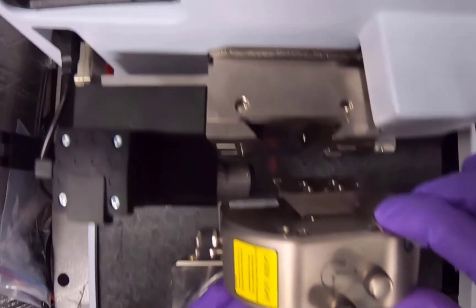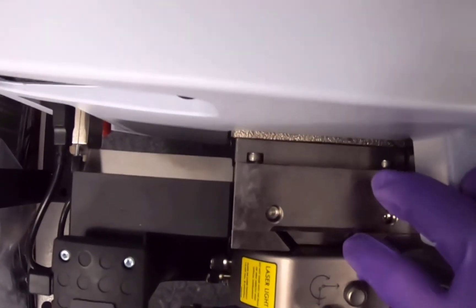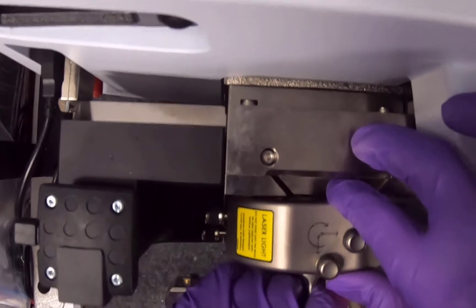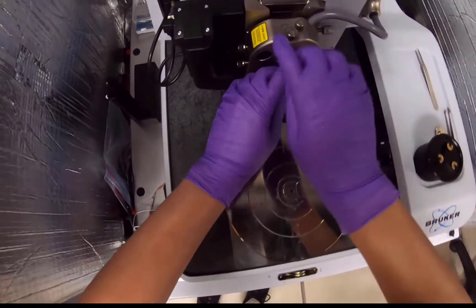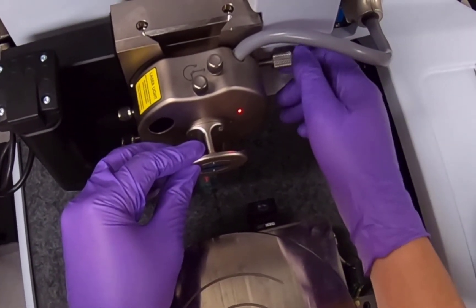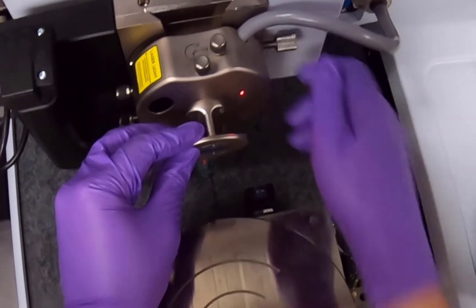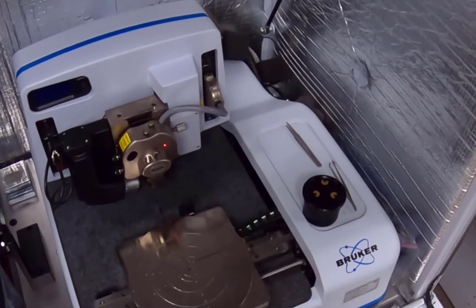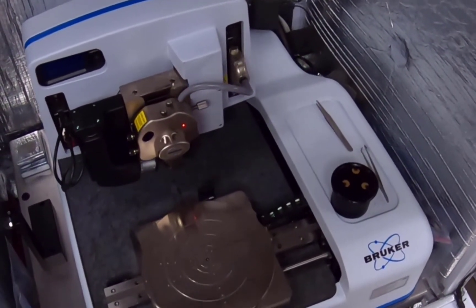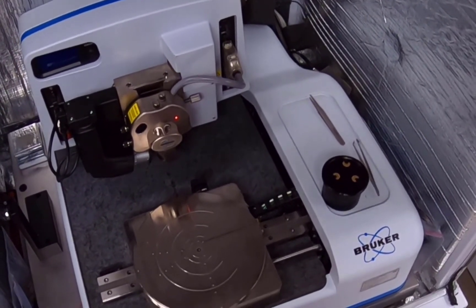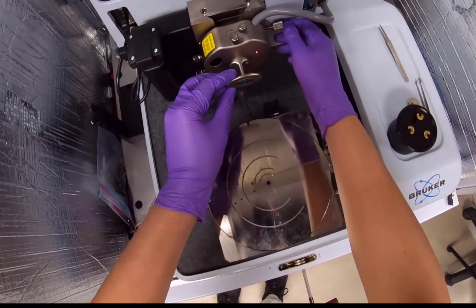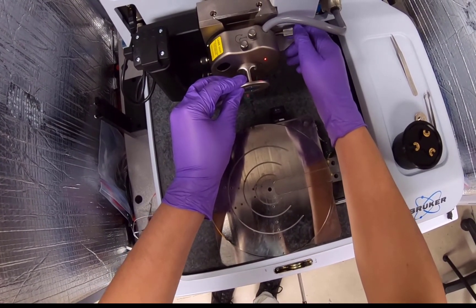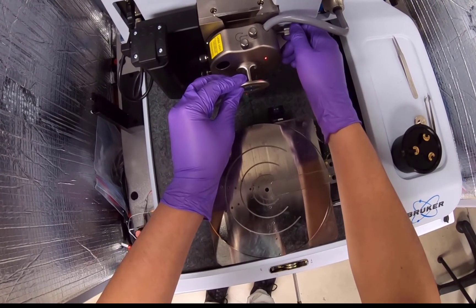Replace the scan head into its mount and verify it is seated all the way down on the dovetail guide. You should be able to see black alignment marks. Make sure the scan head will not drop down before releasing it. This is the most expensive component of this instrument, so it is critical that you use care anytime you are handling and manipulating the scan head. Once the scan head is secured in the dovetail guide, gently tighten the scan head set screw by tightening the knurl knob clockwise.